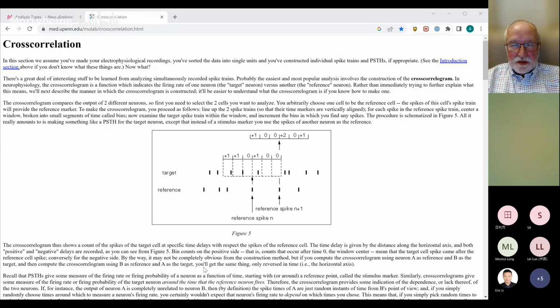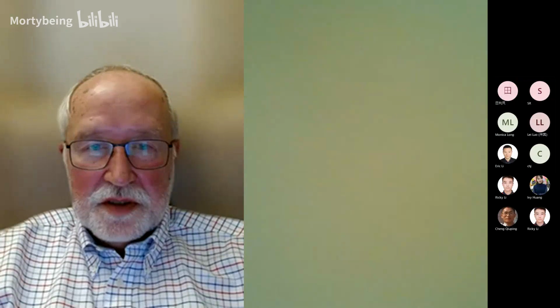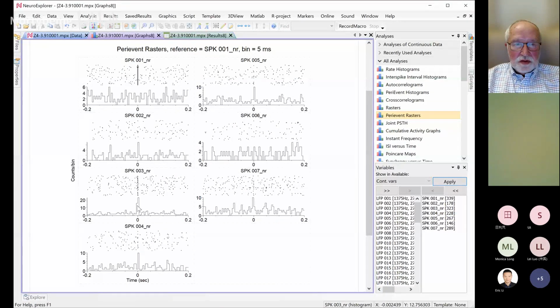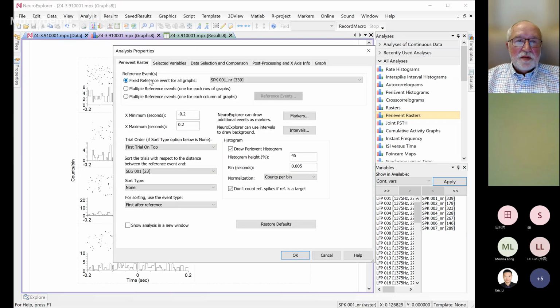Okay, so let me go back, stop sharing, and share NeuroExplorer. So this is what it shows you. If we want to know what the firing differences are between before and after stimulation, that is the idea of the PSTH. What should we set as 0? The stimulus? Yes, it's called reference. In the parameters, the first parameter is reference.